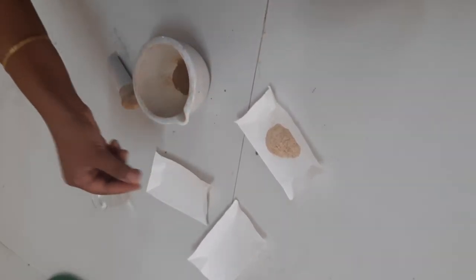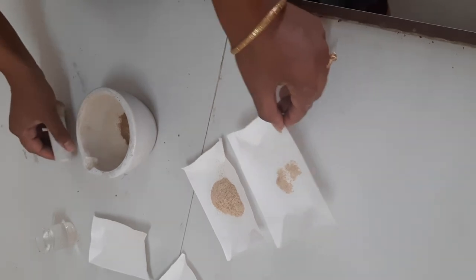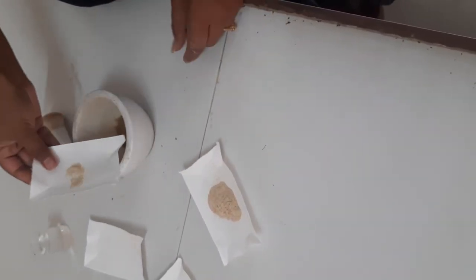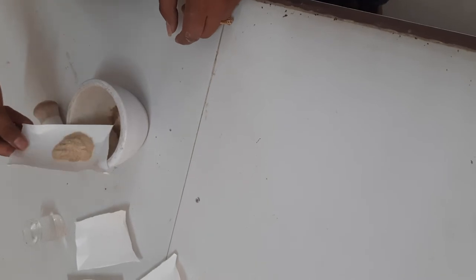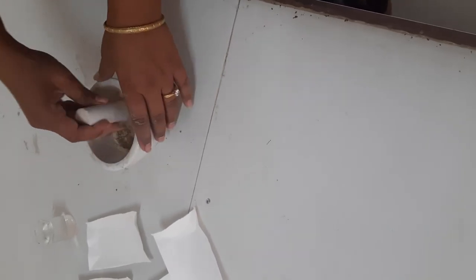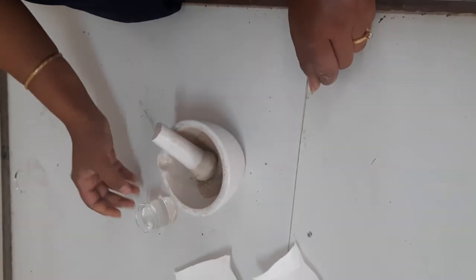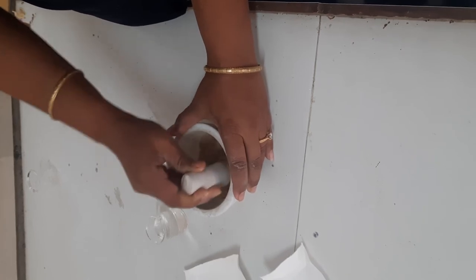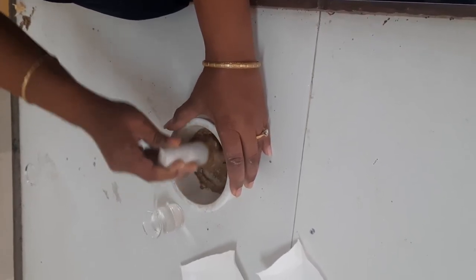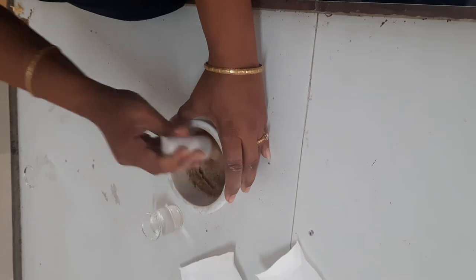The second ingredient is shikakai powder — I have weighed 10 gram of shikakai powder. Next we are going to add a pinch of orange peel powder which acts as a perfuming agent. Then last but not least is reetha powder, which acts as a foaming agent. We are going to mix all these powders in dry form. After that we are gradually mixing water into it. While mixing water we have to take care that there should be continuous trituration so that the consistency of the shampoo will be obtained.